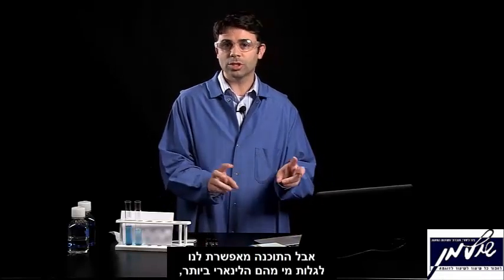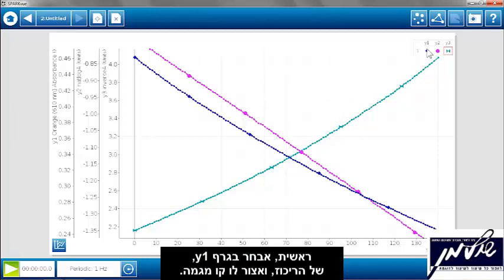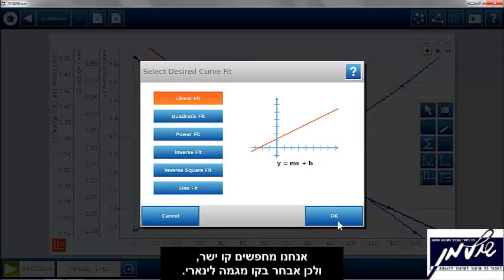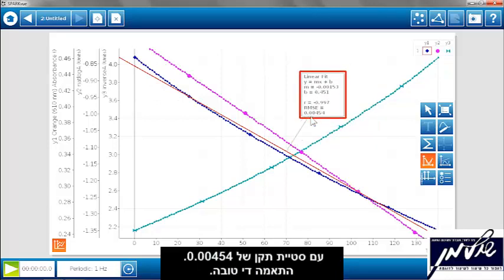can figure out which one is the straightest, or which one has the best fit. So first I'll select my y1, which is absorbance, and I'll do a fit on there. We're looking for straight lines, so we'll do a linear fit. And the R in this case is 0.997, with a root mean square error of 0.00454. It's pretty good.